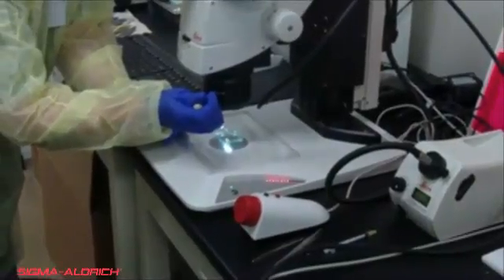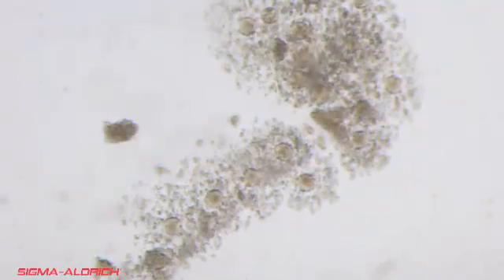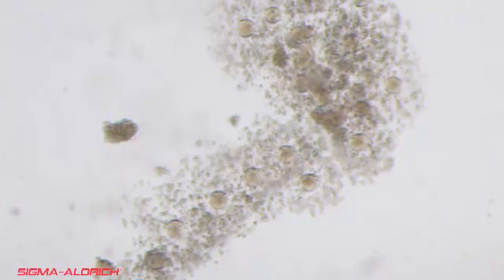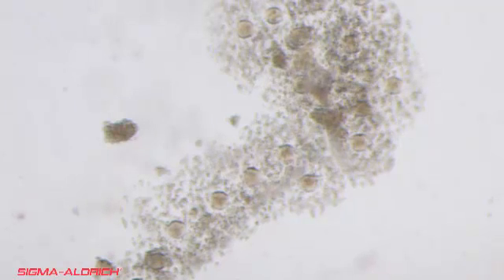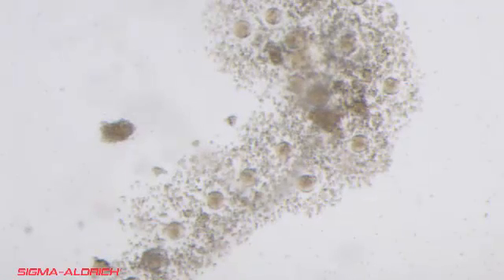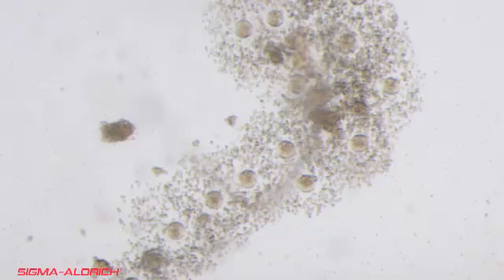Carefully add hyaluronidase to remove cumulus cells surrounding the embryos. After 5 minutes of incubation, the cumulus cells should dissociate and the embryos can be collected in a glass capillary tube and moved around the media to further clean them of cumulus cells. We recommend a solution that is 1 mg per ml hyaluronidase with 10 mg per ml polyvinyl pyrrolidone in 0.9% saline.